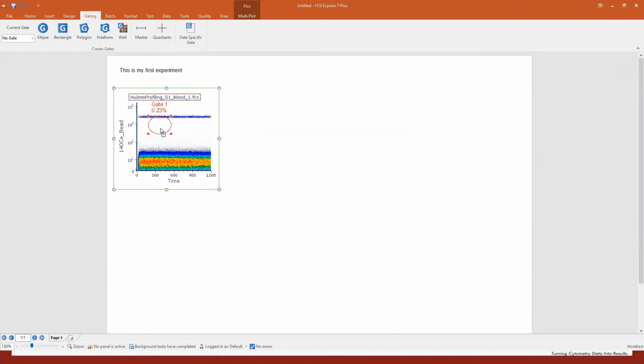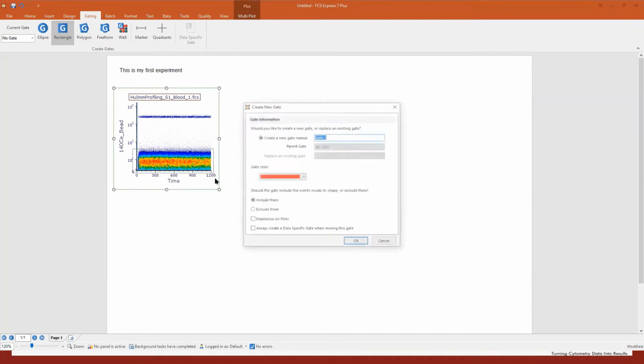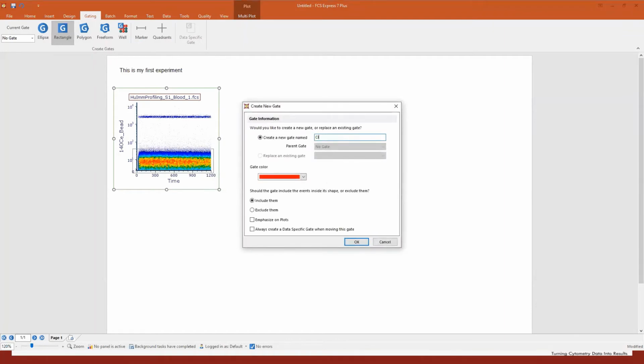Now, in this case, instead of an ellipse or freeform gate, it's much better to create a rectangle. So we'll create a rectangle here, and let's call it cleanup 1. Red, click OK.